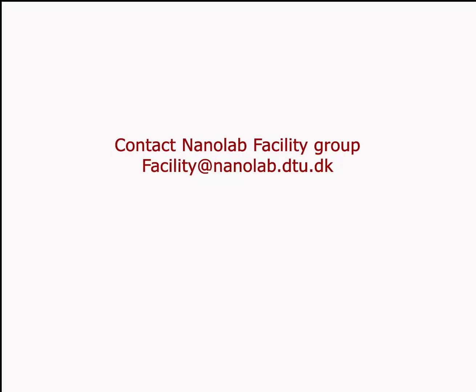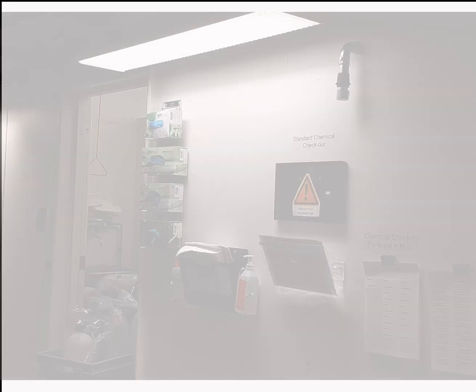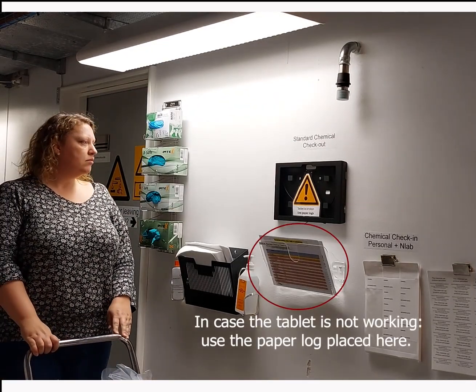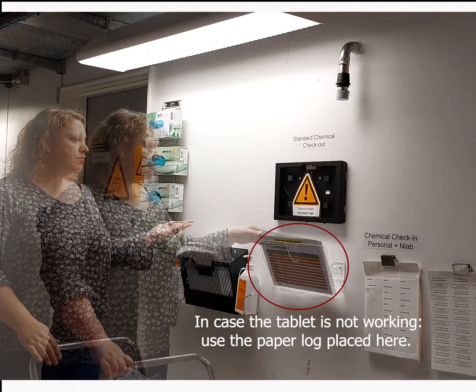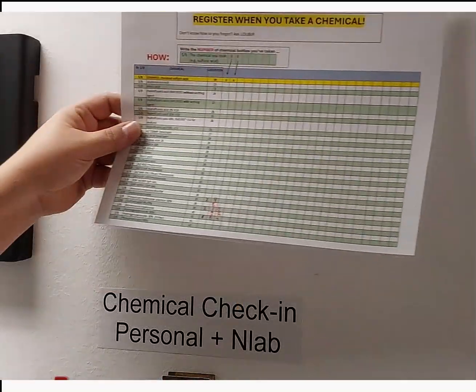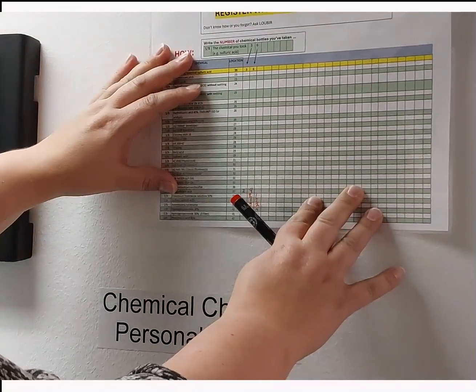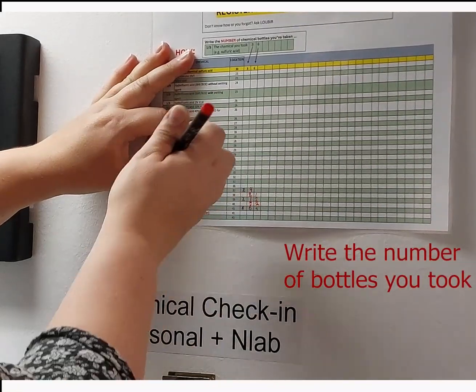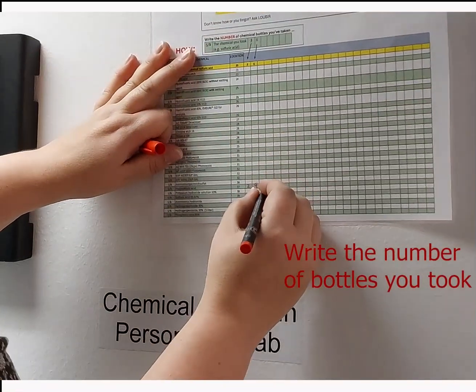Should any other mistakes happen, you can write to the facility group and let them know. Please note that the old system is still available in case of power outages or other IT issues as we test this new system. The old system involves a paper log. Locate your chemical, follow the row horizontally to an empty box, and write the number of bottles you took.